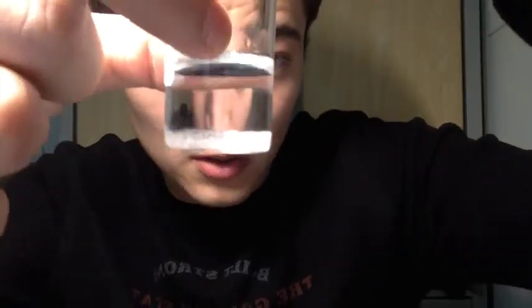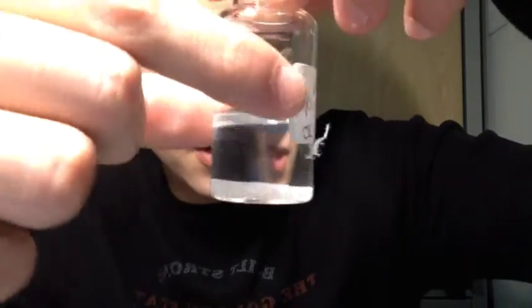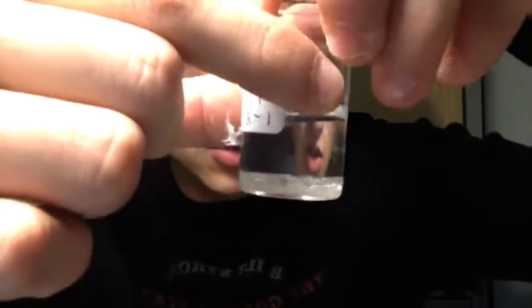Hello, so here are my crystals at the point of Alum video 3. As you can see, they now occupy the whole base of the little beaker. So that is about a 1/3 increase in area compared to last week's.